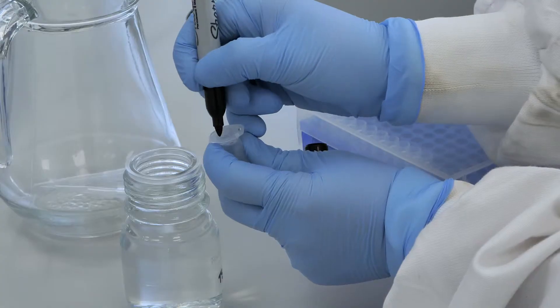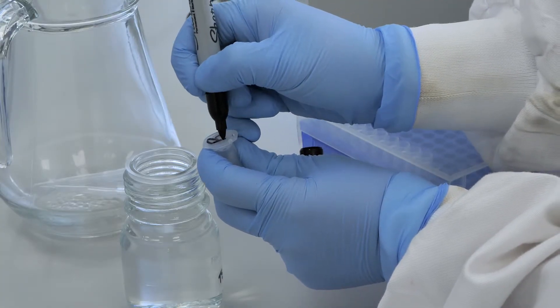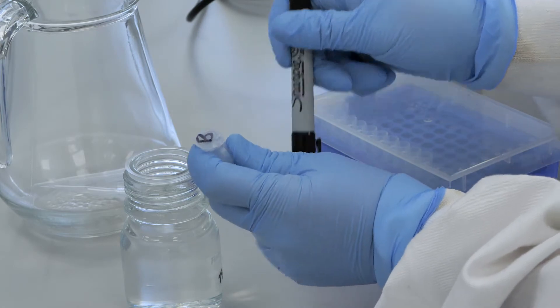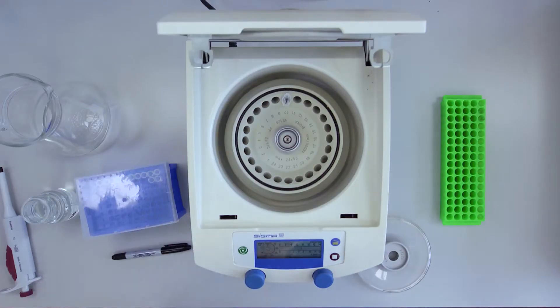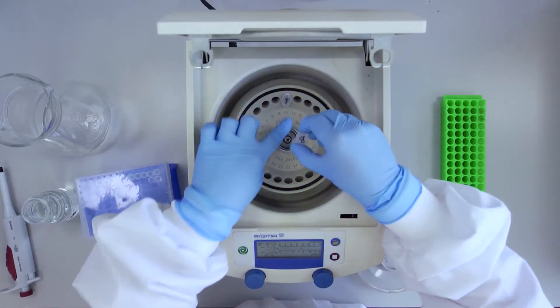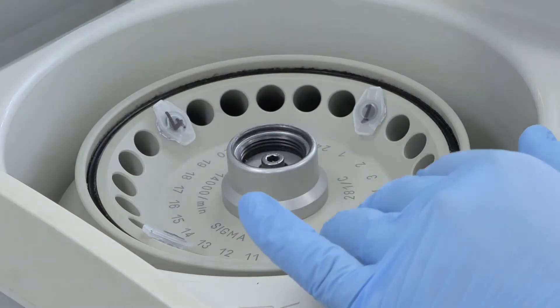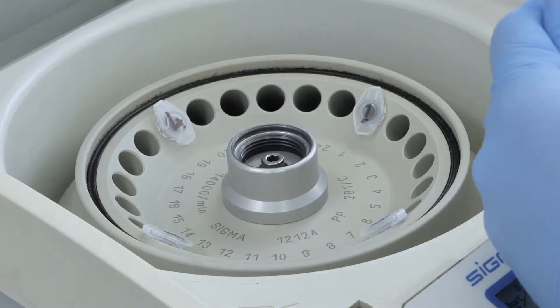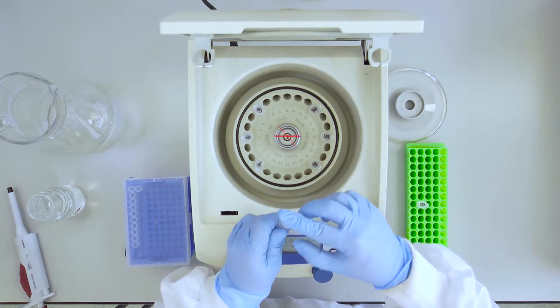Make sure all tubes are labeled. If you are spinning more than two tubes, always make sure you load tubes directly opposite each other.